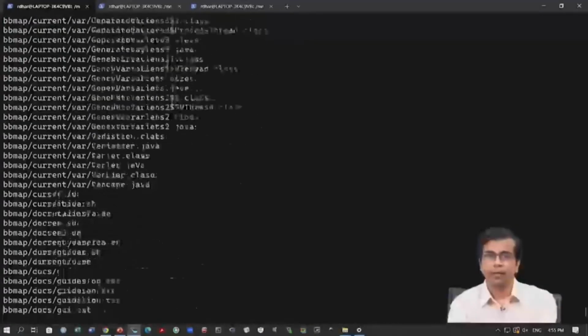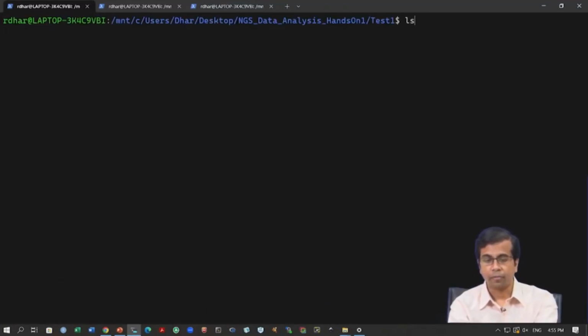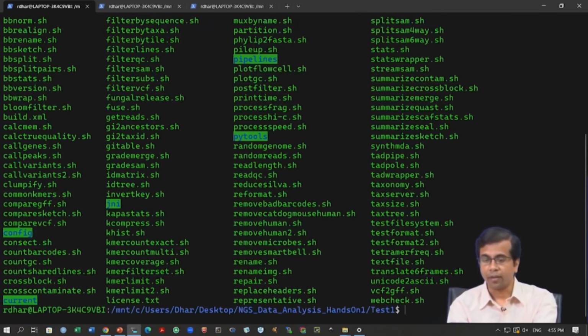So, once we do that, it is extracting all the functions, all the tools. Okay. So, it is done now, and we can check what has happened. You can see it has created a folder called BBmap, inside which you have all the files, all the functions, all the tools.